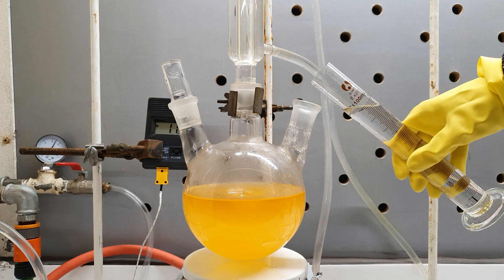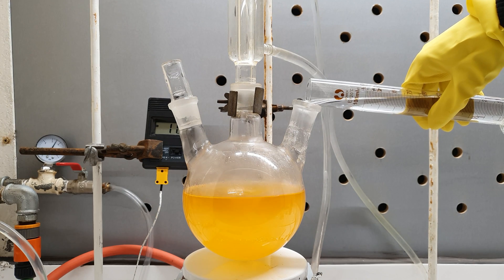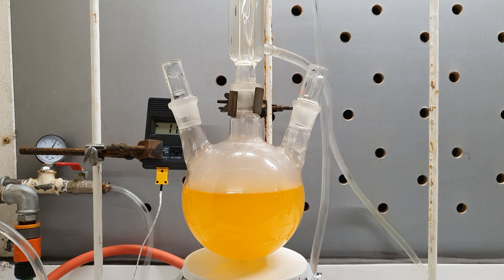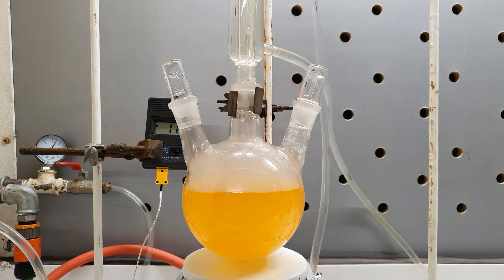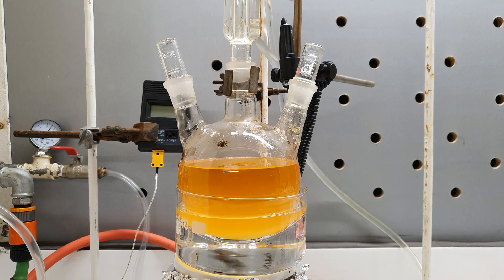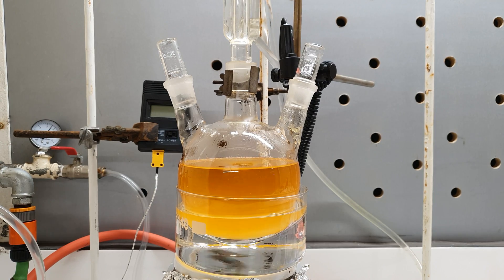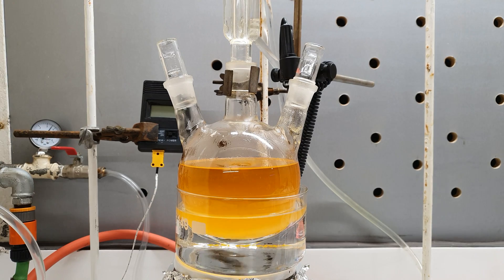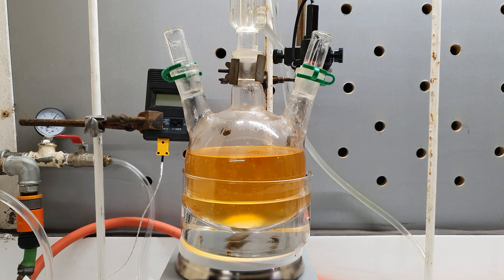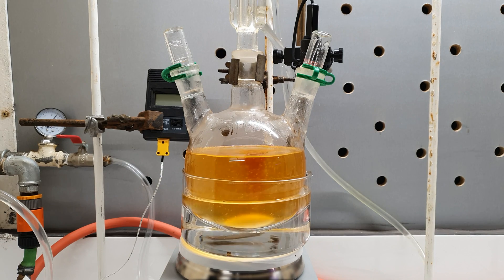I added the butanol to the flask, then equipped it with the reflux condenser. The last component we need is 110 milliliters of concentrated sulfuric acid — just for good luck. Its addition, as always, proved to be very exothermic, so I decided to add it through the condenser instead. The next step was to heat the solution under reflux. At this point I realized I might have overfilled the flask, but whatever — we are all going to die one day. The flask was heated on an oil bath until it started to boil. The particles you see flowing inside are boiling stones, to reduce the risk of dying — I mean bumping.